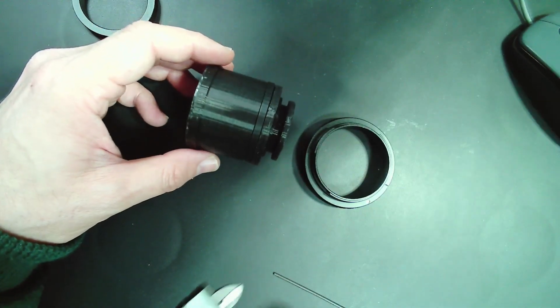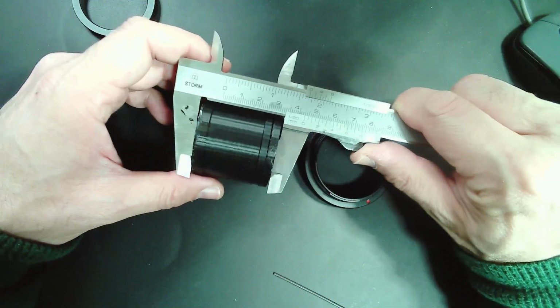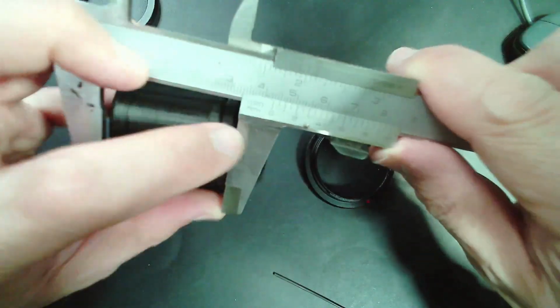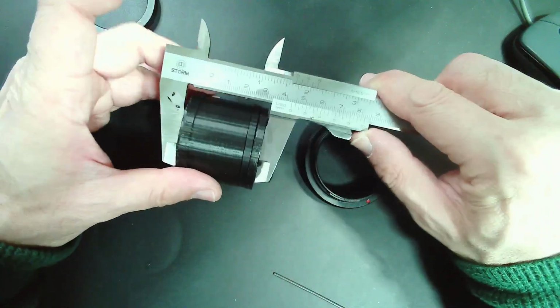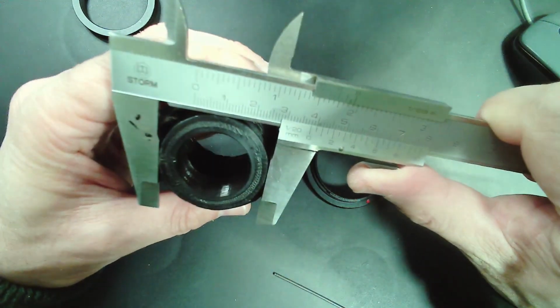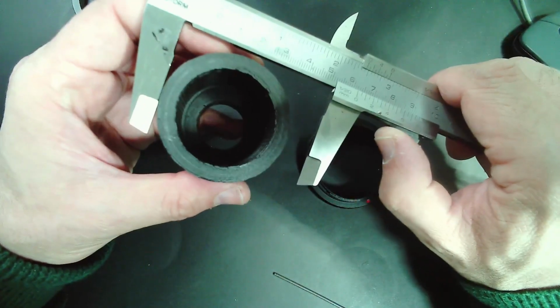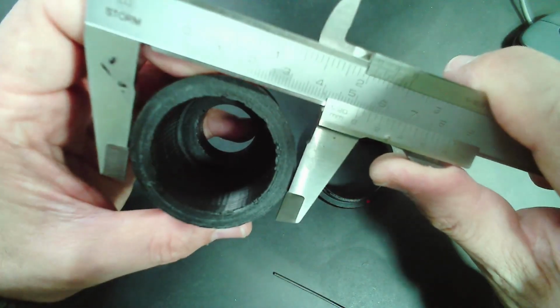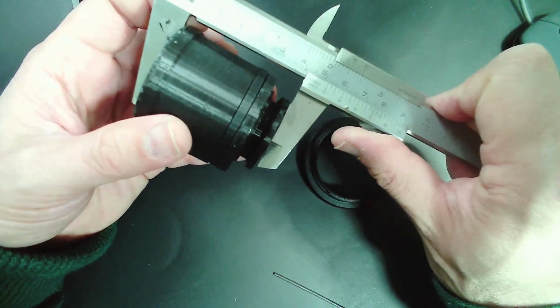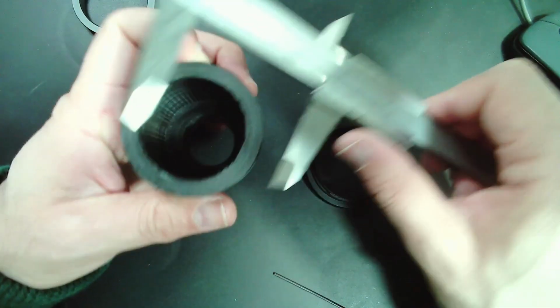Yeah, so I took it apart again because I actually wanted to show you the size here, okay? So this here is 43 millimeters. Okay, I don't know if you're able to see it here. It's about 43 millimeters here. This part down here is 38 millimeters. And this top part here is 52 millimeters. Okay. And the overall length of the adapter is 52 millimeters as well.